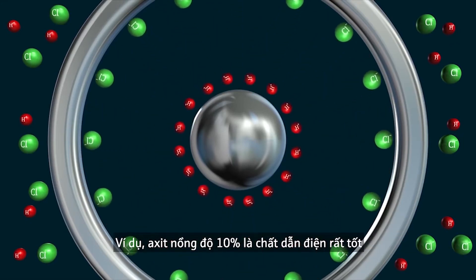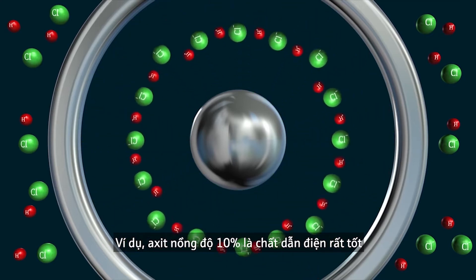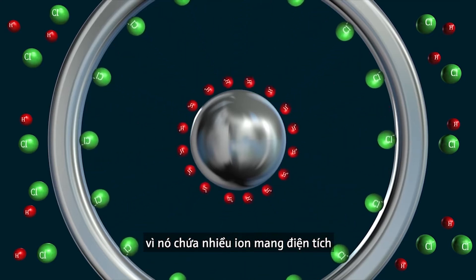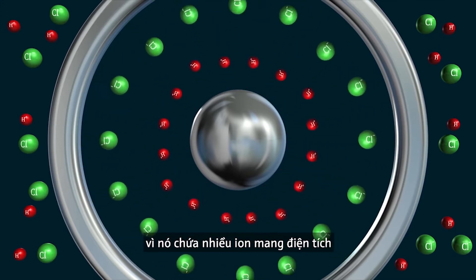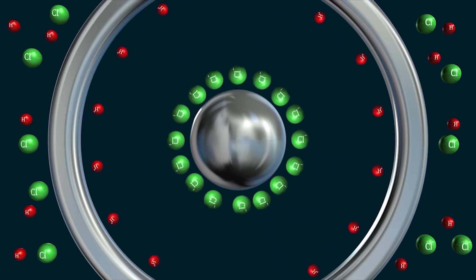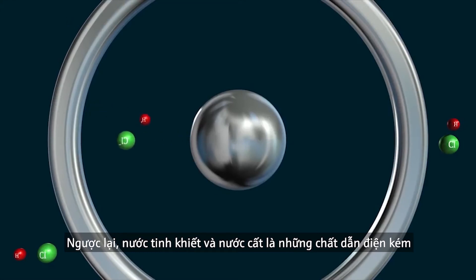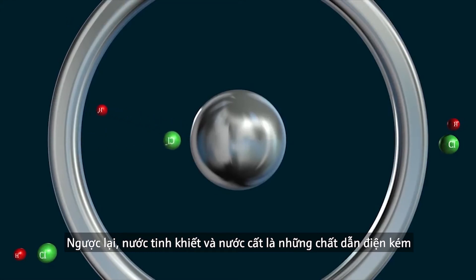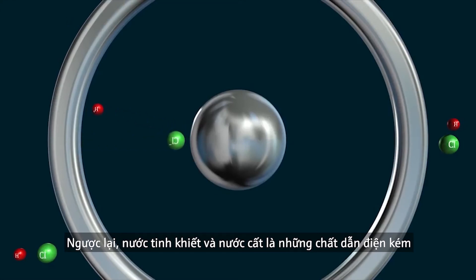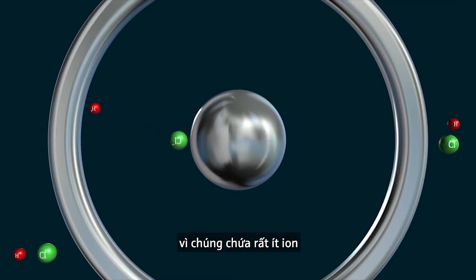A 10% acid, for example, is a very good conductor because it contains many ions that transport the charge. In contrast, pure and ultra-pure water are bad conductors because they contain only few ions.